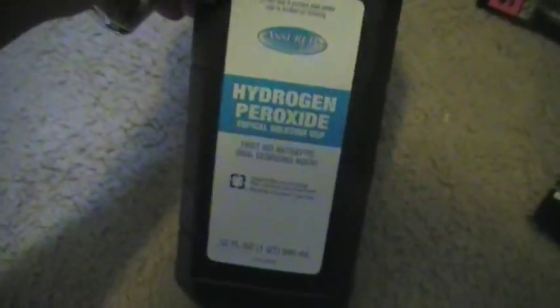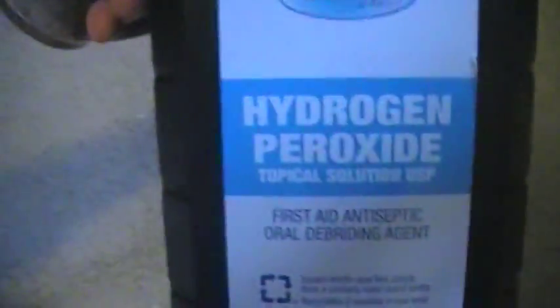I don't know what thirty percent would do; it might do it better. I'm not sure — I'll try that and make another video just telling you if it does work. What you do is you get 50% hydrogen peroxide and then you add it to 50% vinegar, so it's a 50-50 solution, and you put a piece of copper pipe in. Over some time — about 30 minutes — it'll turn this really really cool blue color.